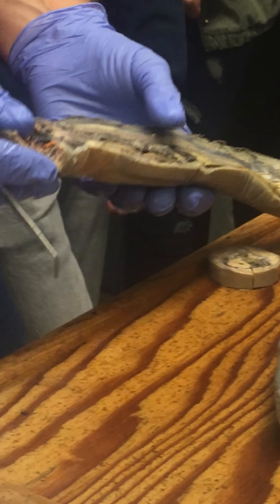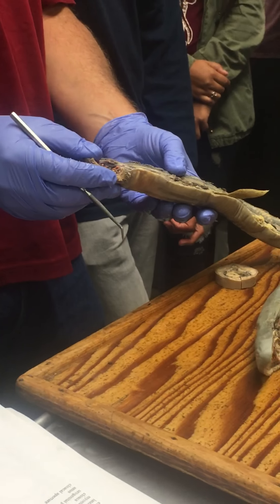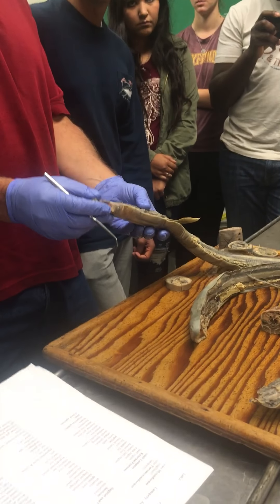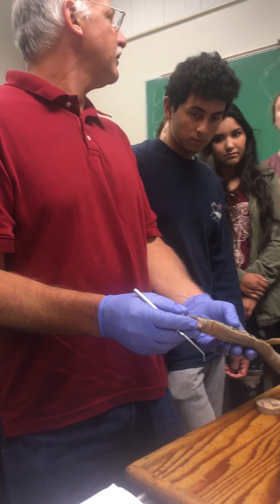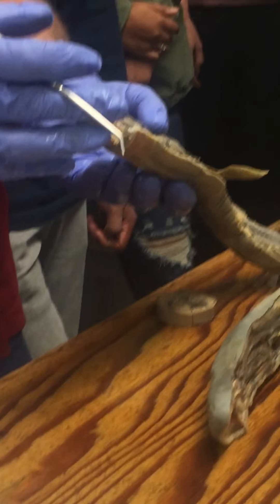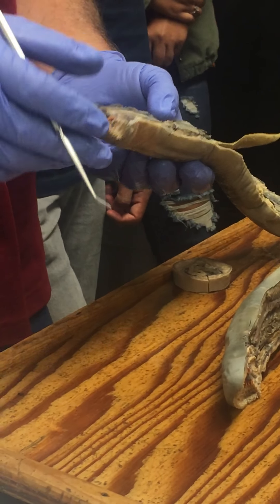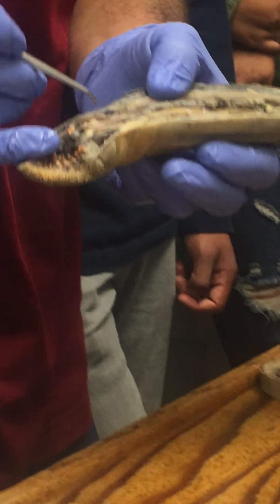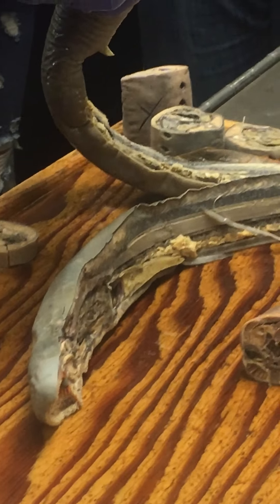Chondrocranium — chondro means cartilage, so chondrocranium means cartilage skull. The chondrocranium is basically the whole system of cartilages that supports structures in the head region, including around the brain and the sense organs. If you feel with your probe, you'll feel little hard structures present in this region — that's the chondrocranium surrounding the sense organs and the brain.